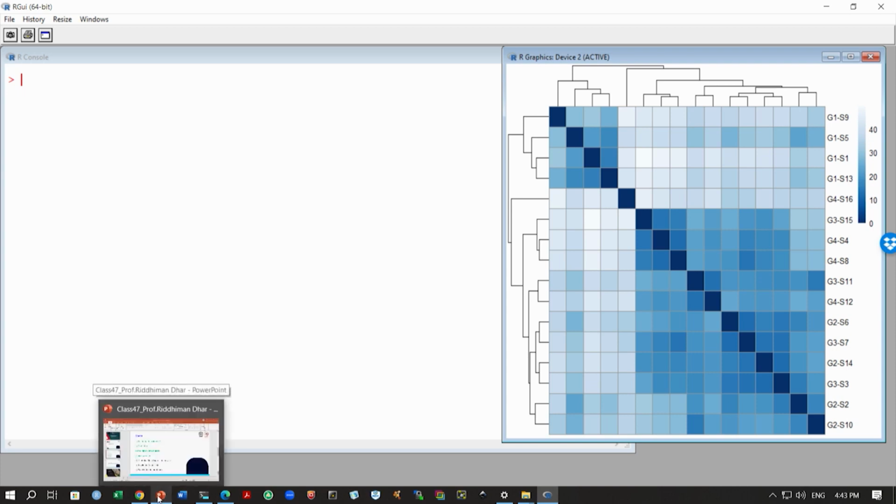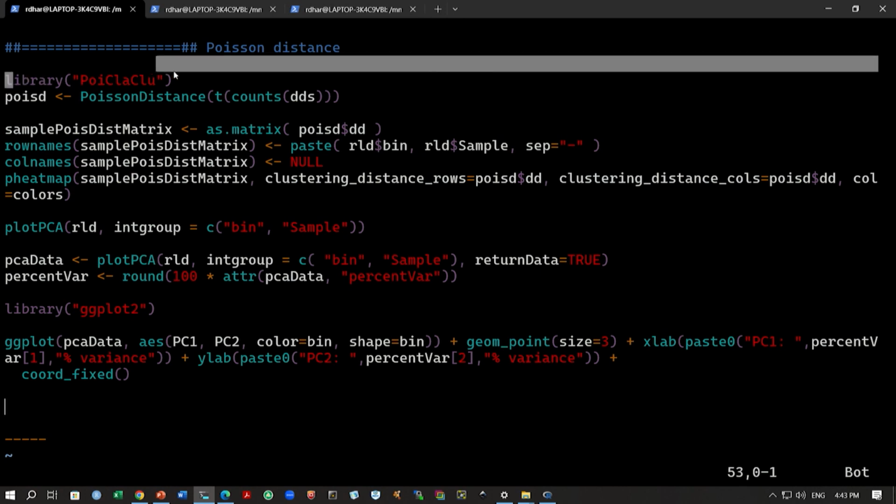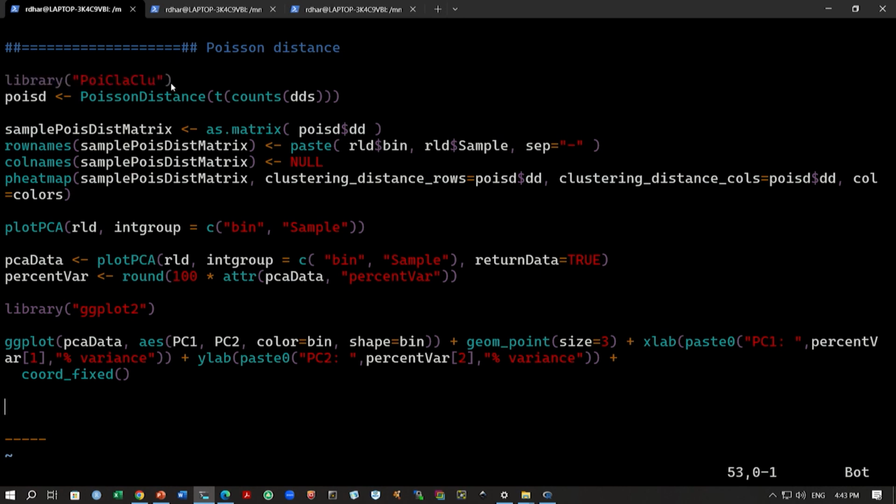But if we want to do this analysis on the raw data counts, we have to calculate something called the Poisson distance. Why? Because with raw data counts there will be a lot more variability, as there is no transformation done. So, we have to calculate the Poisson distance, and we can calculate that using a specific library built for this purpose, and we follow the same steps. Instead of this function, we use this Poisson distance function. This comes from this library, and then we will generate the sample Poisson distance matrix, and we will use pheatmap as before to generate this distance based clustering or distance based heat map.